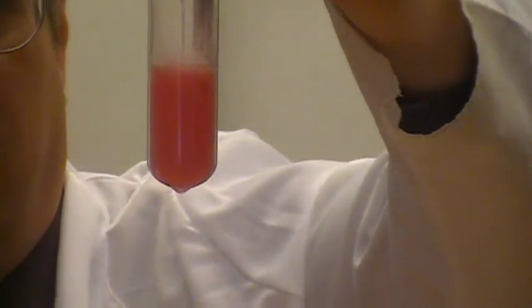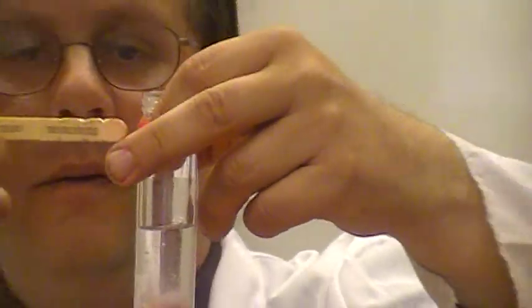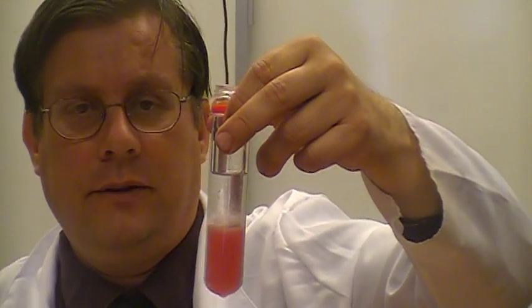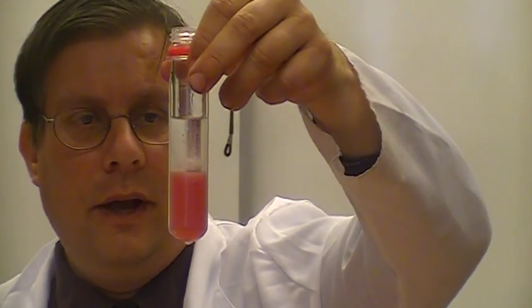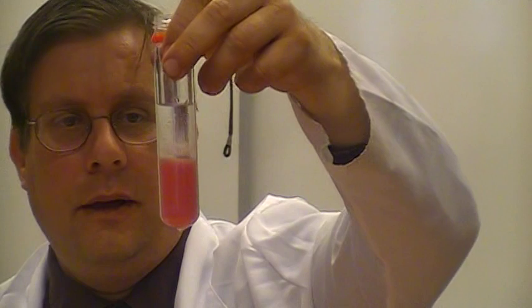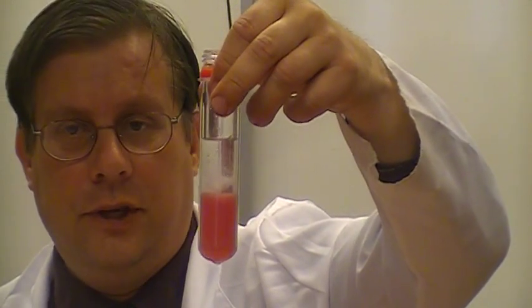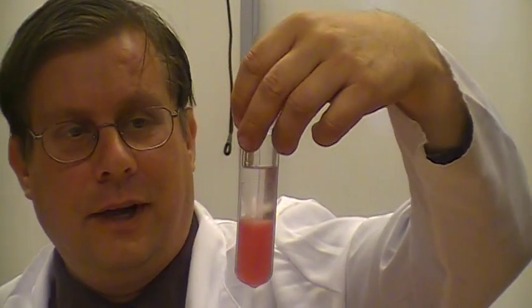And as soon as I see enough DNA forming, I'm going to take this popsicle stick and I'm going to wrap it around. And you can see it forming on the bottom here already. I don't know how well that's showing up on the camera, but you can see a layer of it forming right here. I'm going to try to take the popsicle stick and we've cut little grooves into it and scoop up some of it. Sometimes it works, sometimes it doesn't. But either way, you can definitely see the DNA. But I said we're going to touch it and I'm going to do my best to get us there.